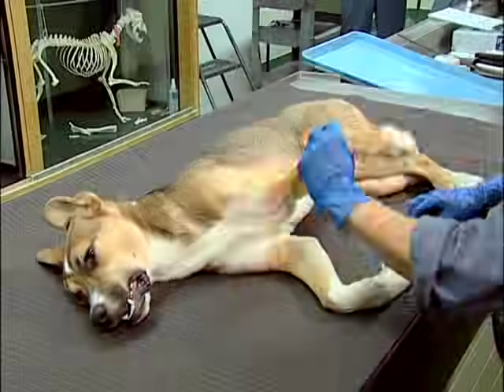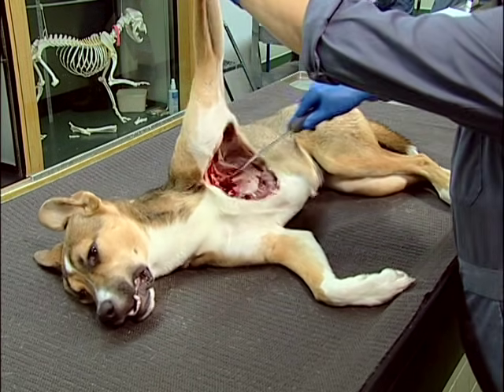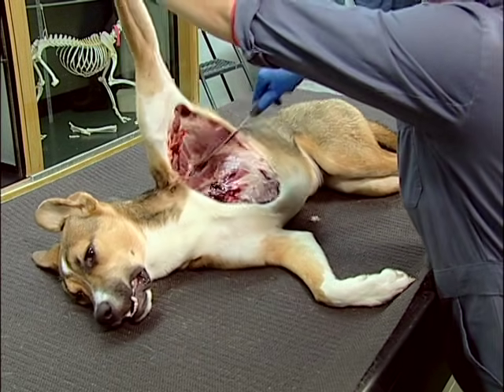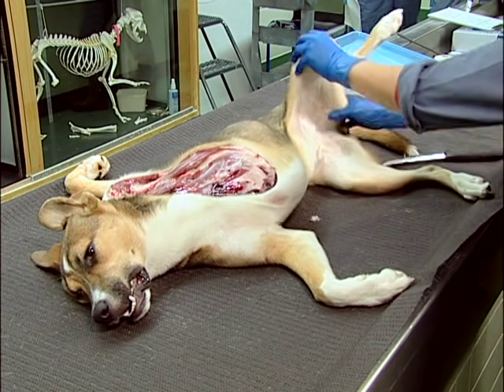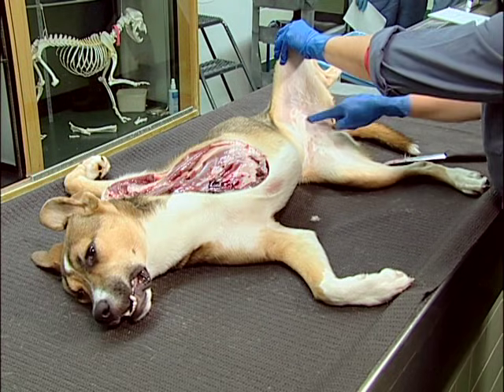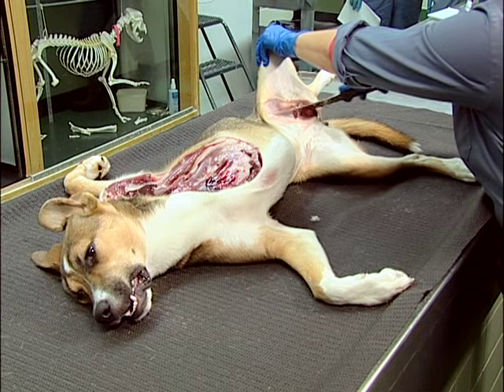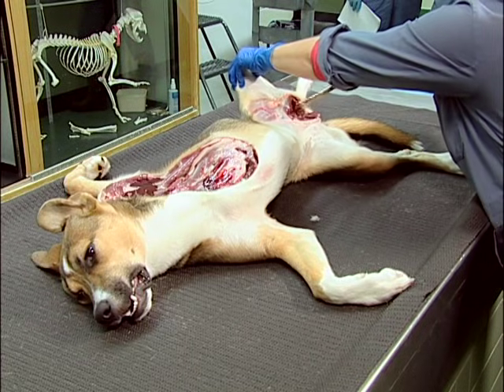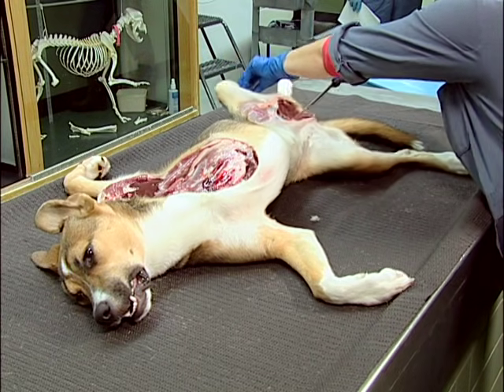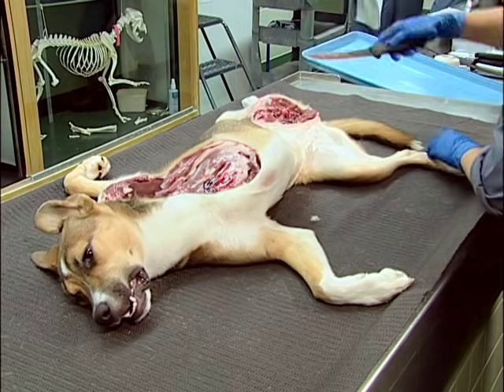Reflecting legs and skinning. To reflect the left forelimb, make an incision into the skin medial to the left elbow. Continue cutting the muscles between the shoulder and the thoracic wall and reflect the forelimb dorsally. To reflect the left hind limb, make another deep incision into the medial aspect of the left thigh along the shortest line connecting the left stifle with the anus. Open the coxofemoral joint and sever the round ligament. Then examine the synovial fluid and reflect the hind limb dorsally.